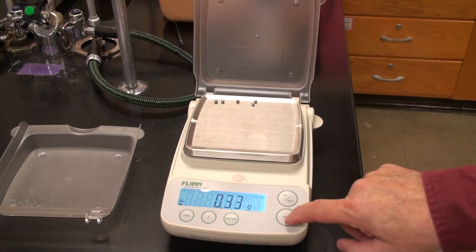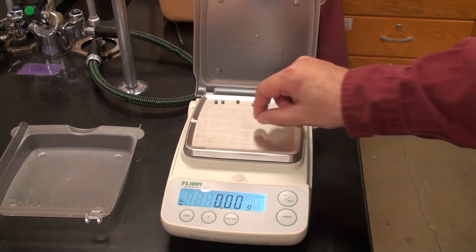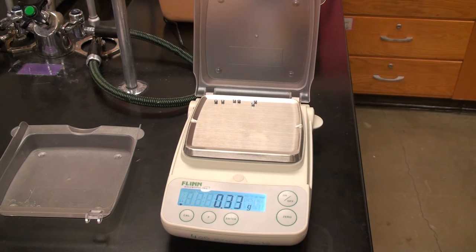Okay. Some of these we just have to take our best shot on, and that'll be the way it is.